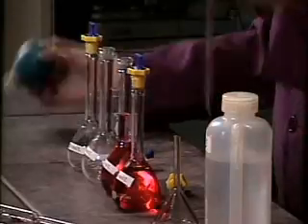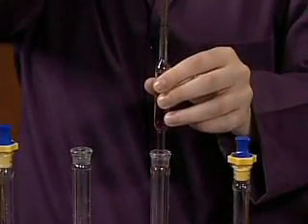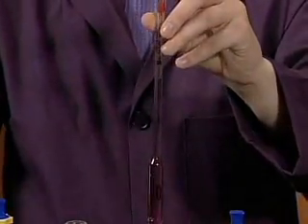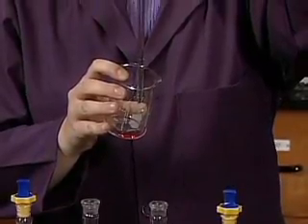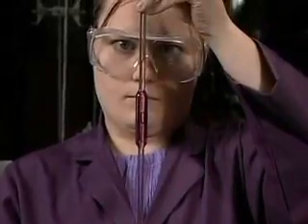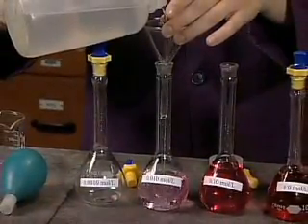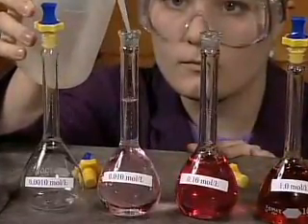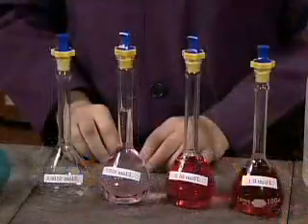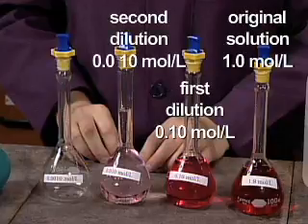The second dilution begins by pipetting 10.0 milliliters of the solution prepared in the first dilution. The 10.0 milliliters of diluted solution are added to a volumetric flask and topped up to the 100 milliliter calibration line with deionized water. The second dilution yields a solution one-one-hundredth as concentrated as the original. Again we see a decrease in the color intensity.